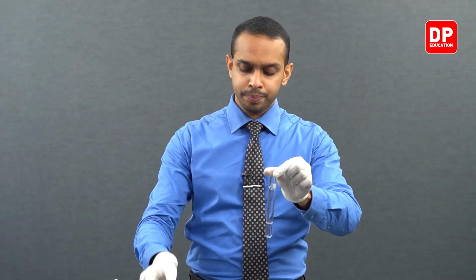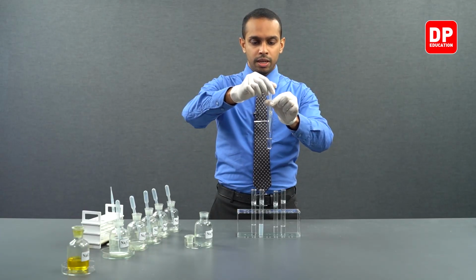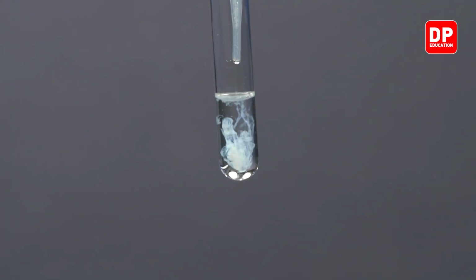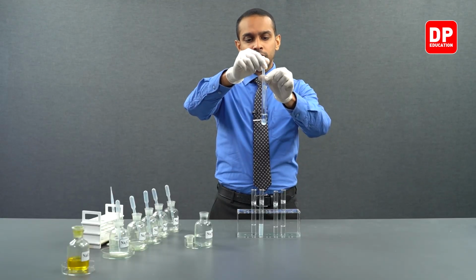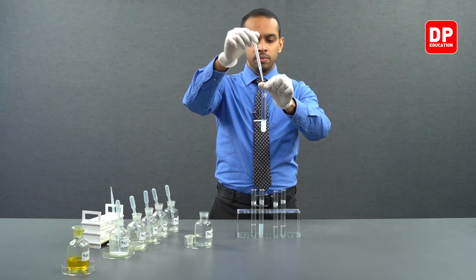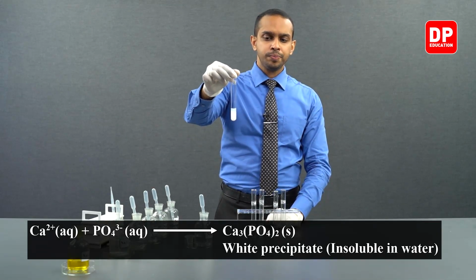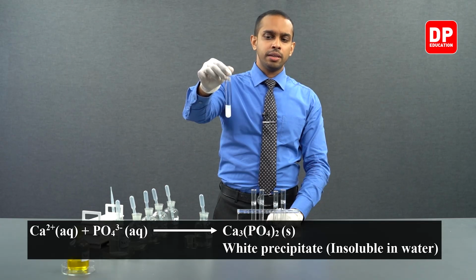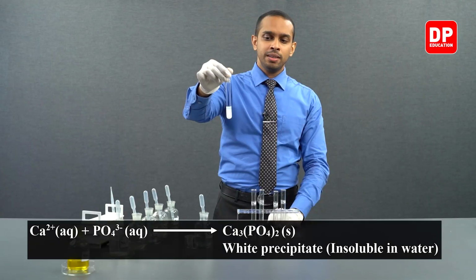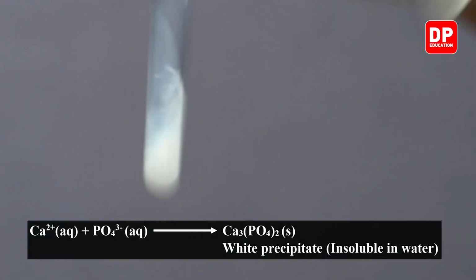To this calcium 2+ aqueous ion solution, we will be adding sodium phosphate, like in the previous experiment. And you can see, upon addition of a single drop of sodium phosphate, a precipitate is starting to form. We added a few more drops to see the precipitate very clearly. Before shaking this mixture, you can see the calcium phosphate precipitate that is formed very clearly here.